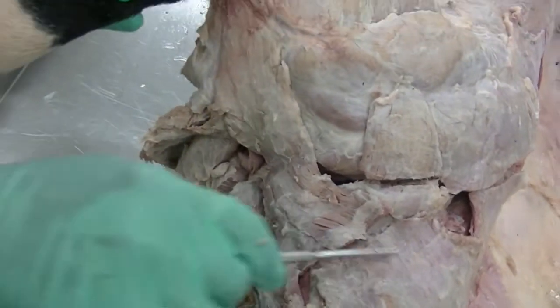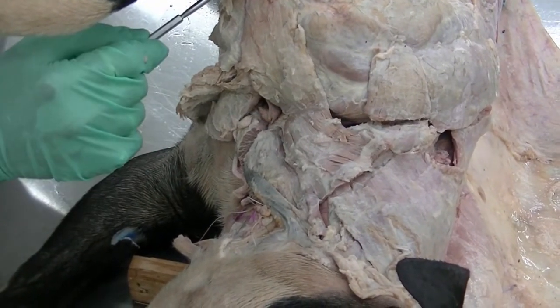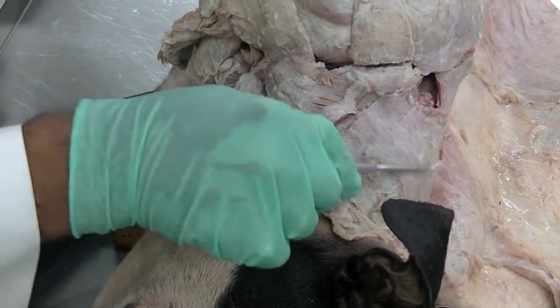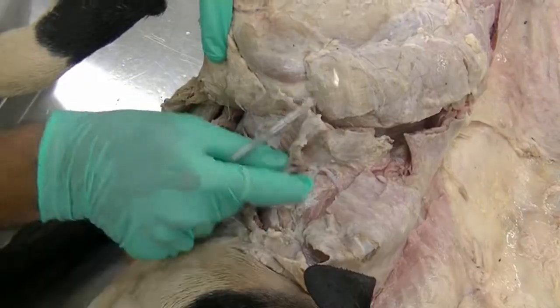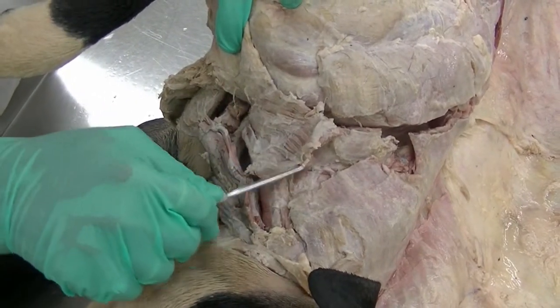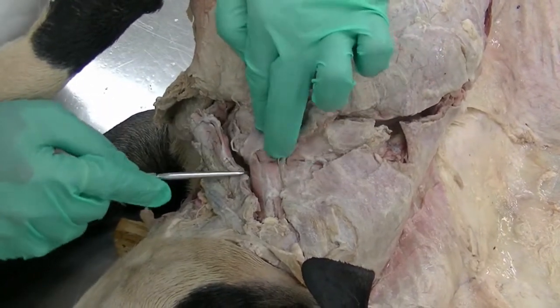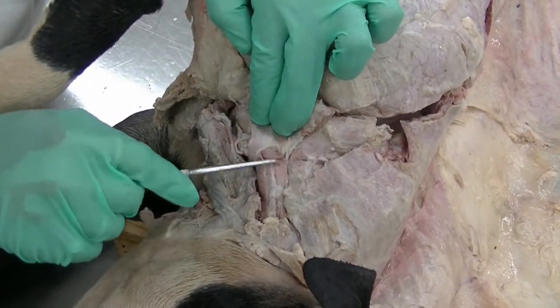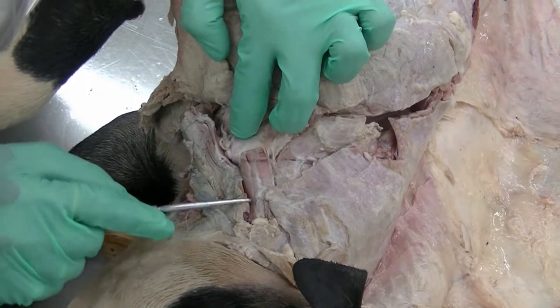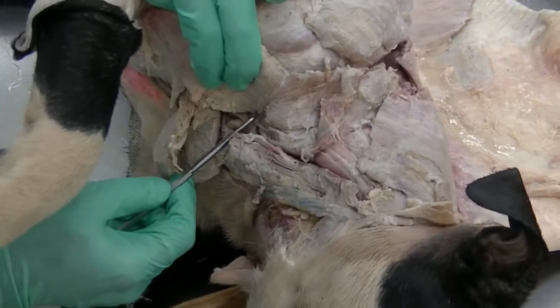So brachiocephalicus as an entire muscle has two different parts from the clavicular intersection: cleidobrachialis and cleidocephalicus. The cleidocephalicus is further divided into cleidocervicalis and cleidomastoideus. As we transected the brachiocephalicus, specifically we can see the part of the cleidocervicalis has been transected. As we reflect it more laterally, we can see a little spindle-shaped part, a little thicker than the flat cleidocervicalis, that is your cleidomastoideus. Both of them diverge from each other from the clavicular intersection.